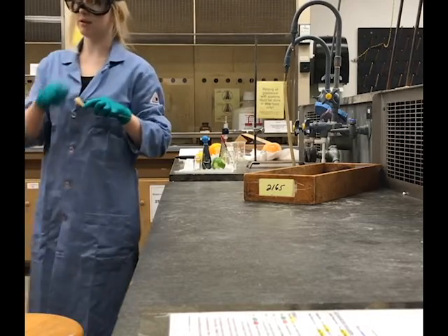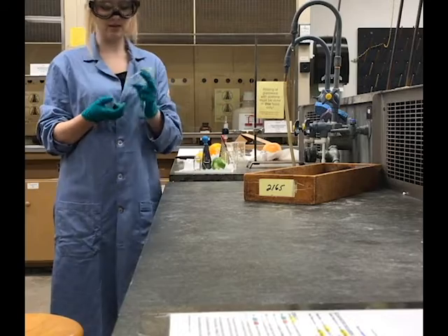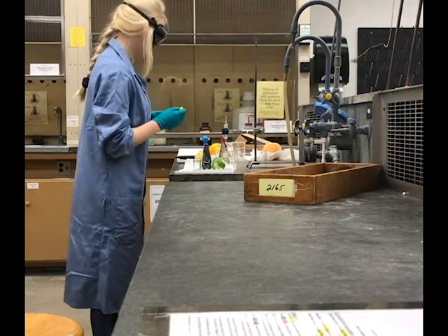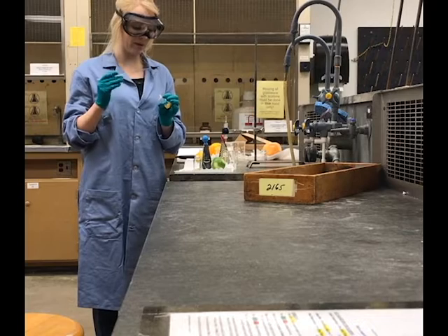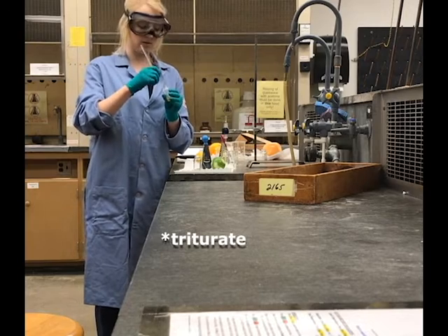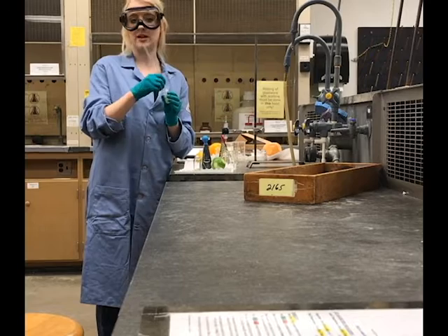I'm going to grab the permanent marker. So we will label each of these new vials. All right, situate it directly under our filtration apparatus, and we will start with the grapefruit first. Before we pipette our methanolic solution, we will first somewhat grind and mash the citrus peel to allow for the maximum extraction of limonene.